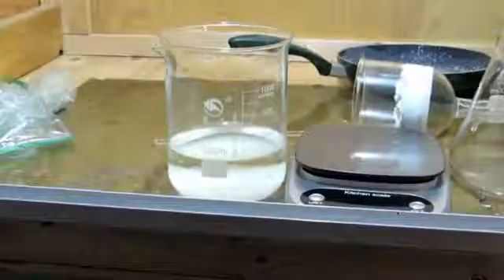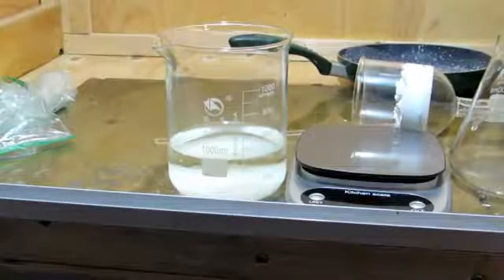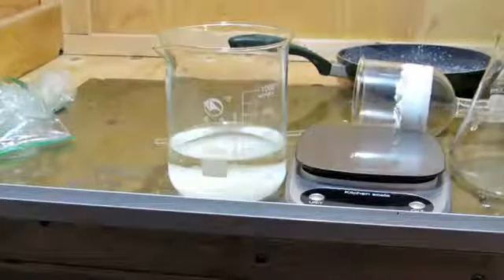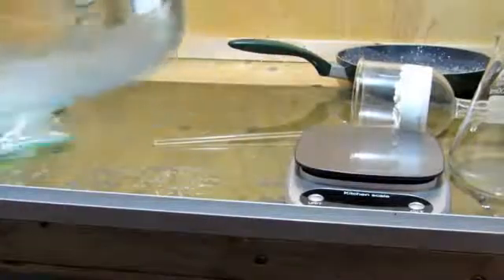So, after filtering, you can see that I have left it for about 8 hours to cool, and something else has precipitated, which is relatively odd. Perhaps it's calcium sulfate that was still in the solution, although it has very low solubility, and that seems very improbable, so I'm honestly quite confused and not exactly sure what this precipitate is.